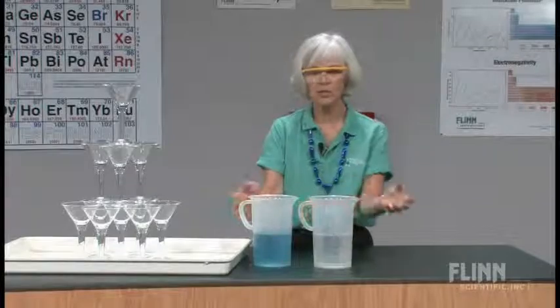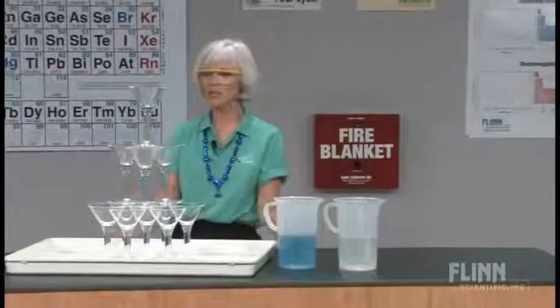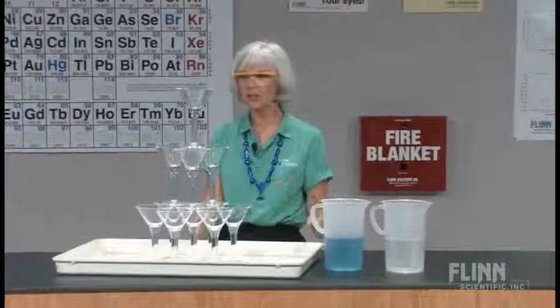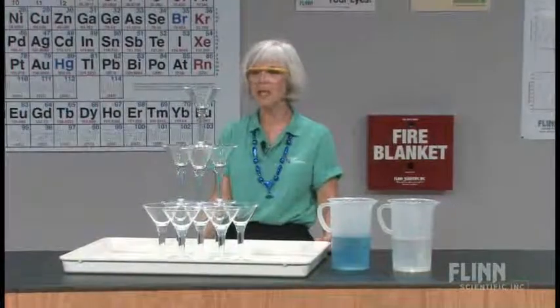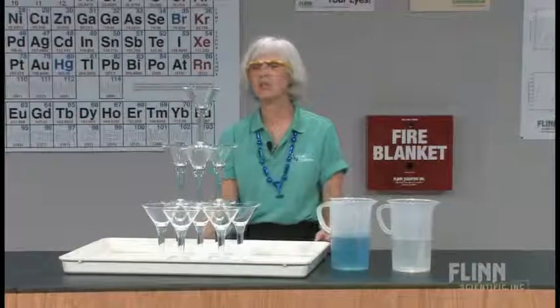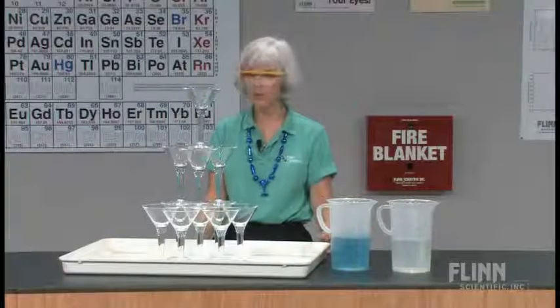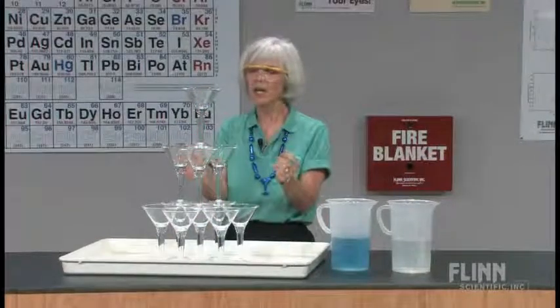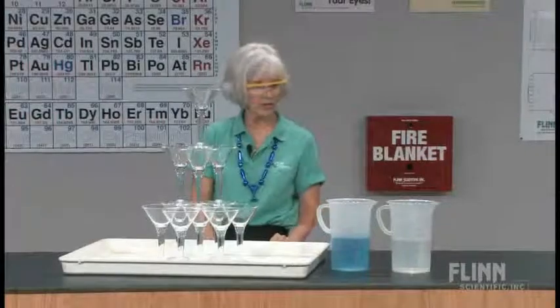What I'm going to do is take and pour these into this particular setup. What we have here is three tiers of party glasses. It's been modified from the Journal of Chemical Education cover because they used, I believe, five tiers. So we have one, three, and seven — a total of eleven party glasses here.